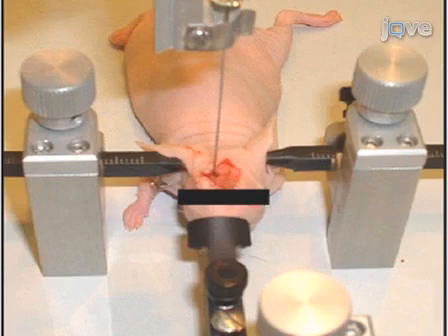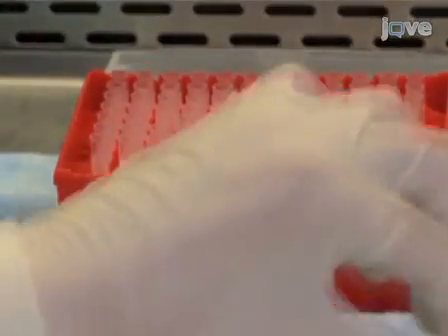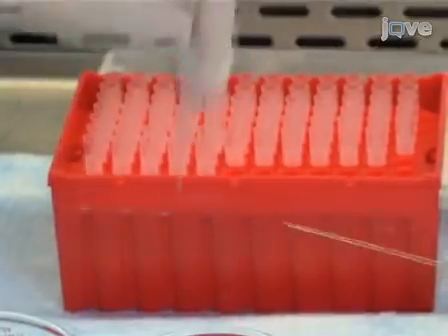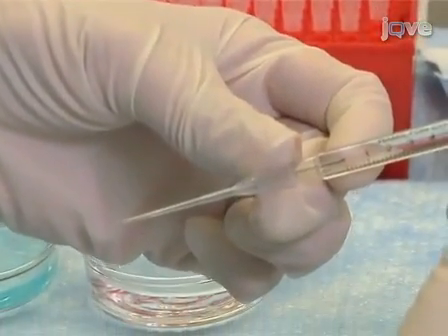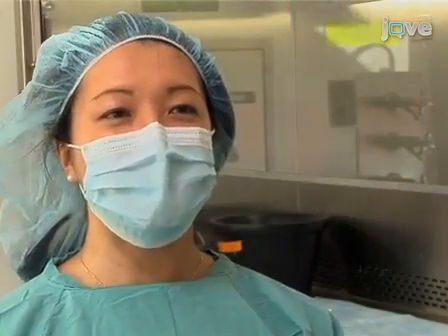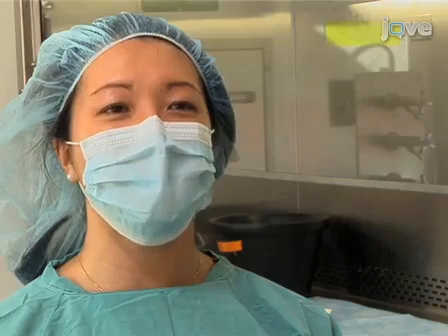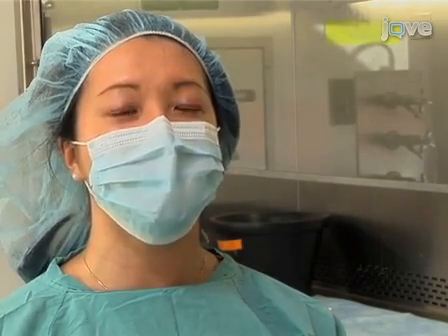To ensure that the appropriate injection depth is achieved when not using a small animal stereotactic apparatus, use a scalpel to cut 3 mm off the pointed end of a P20 pipette tip. Place the tip section over the syringe to limit the injection depth to ensure that the tip of the syringe needle will be 3 mm from the underside of the skull. So the next step in the procedure is probably the single most difficult aspect of the entire method. When doing the following injection, achieving the appropriate depth and the delivery is of the utmost importance.